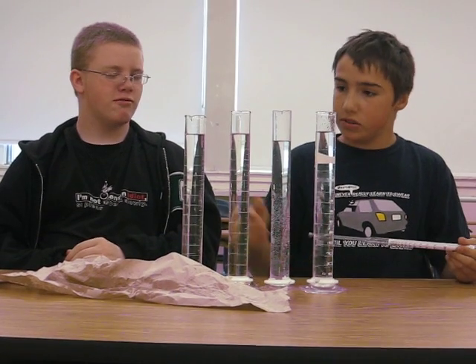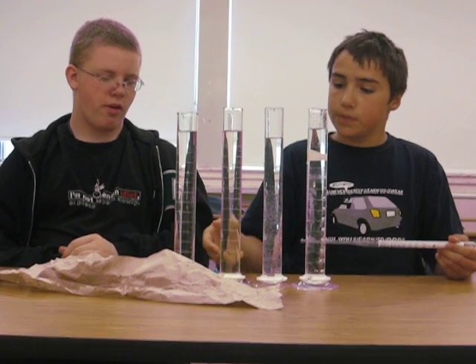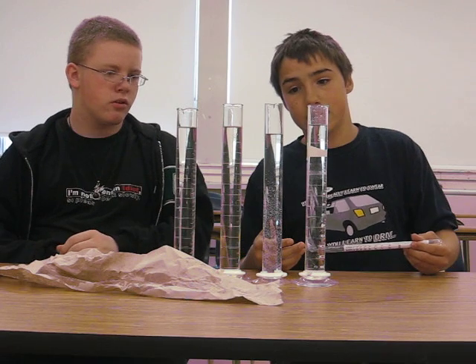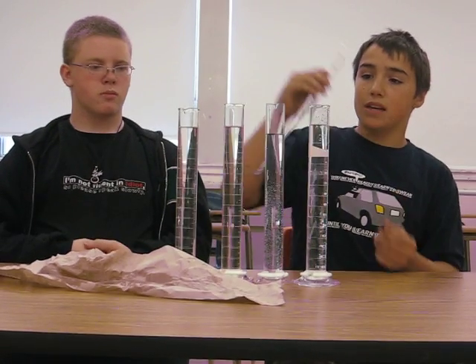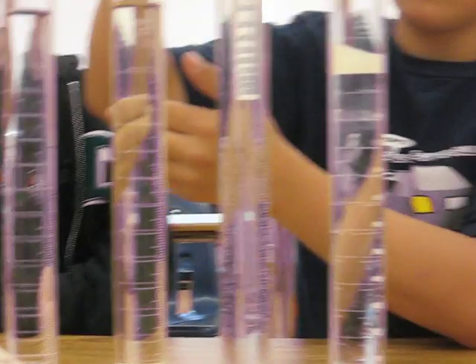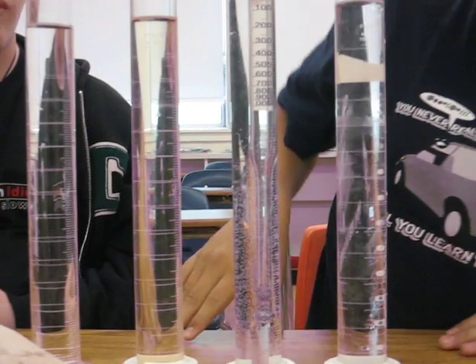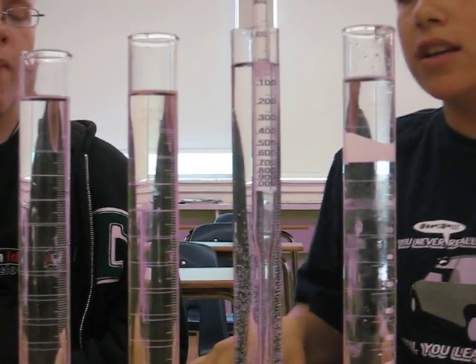So as we told you, rubbing alcohol is 0.9 and this one is 0.76. Now we're going to see the density of water. Water should be equal density, and as you notice, these two would probably float on water. So we're going to drop this in and this should be more dense — it should be about 1, because that's all water is. It's a density of 1.